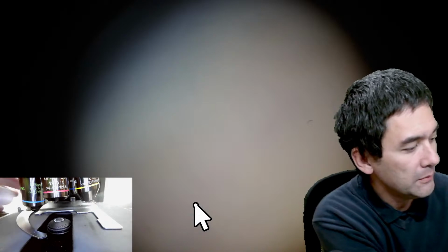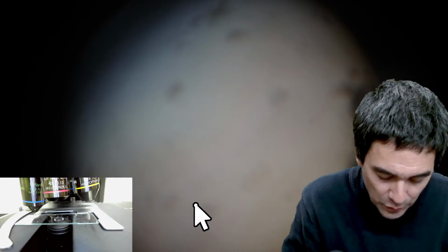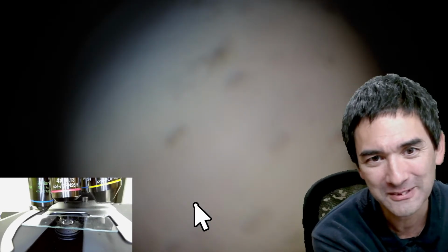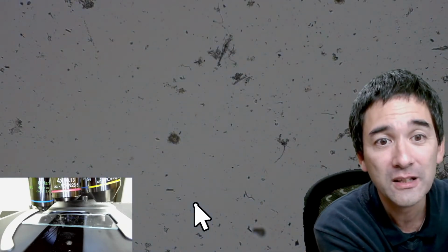So let's have a look. You should be able to see this here. I put it in here. I'm going to move everything else out of the way first, otherwise we're going to knock over a few things. I don't want that. And I have to focus. This is now the 4 times objective. Look, I can't go higher. You see, I cannot go higher because of the focus lock. I have to release it, and now I'm able to go higher. So this was actually a nice demonstration of that. I've still got all of the filters in here.